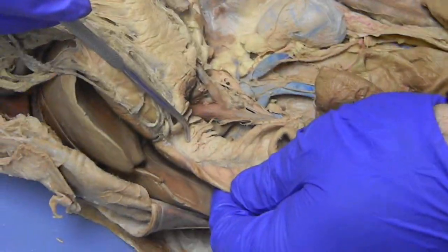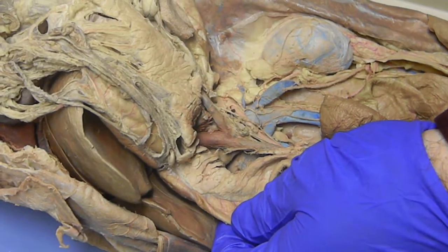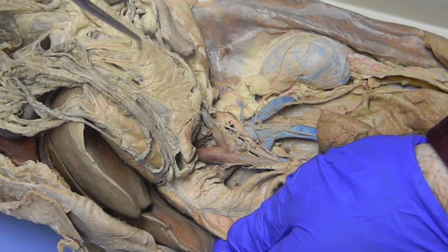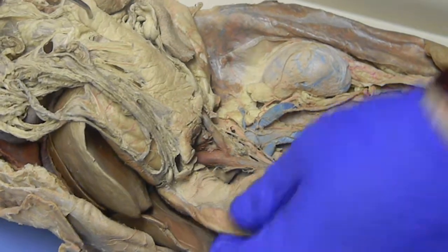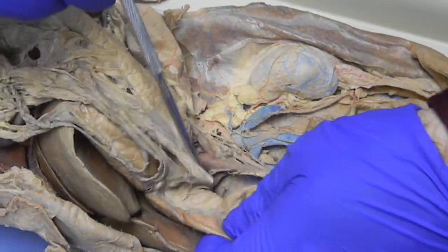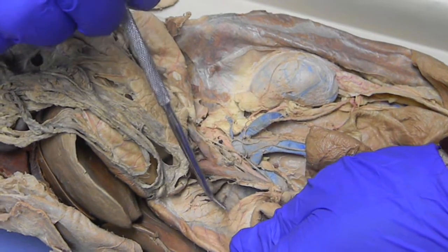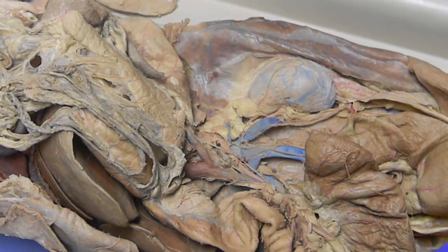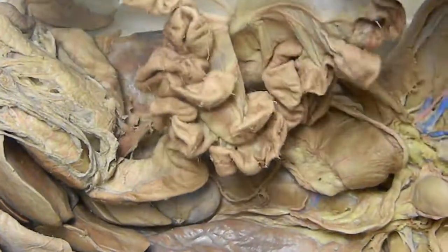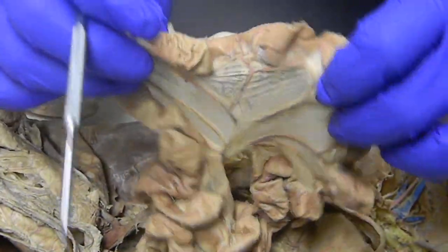In the curve of the duodenum is the pancreas. This would be the dorsal lobe of the cat. This is the ventral lobe of the pancreas of the cat. In the human, it's just a head, body, and tail going over towards the spleen. The duodenum would be affixed to the body wall by a mesentery that's broken here — that would be the mesoduodenum. The rest of the small intestine is held together by the mesentery proper.